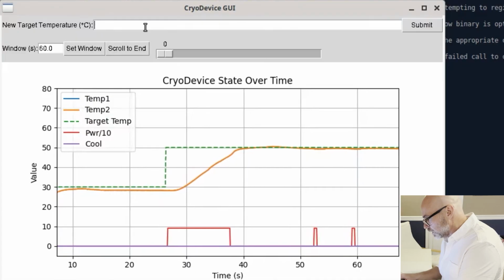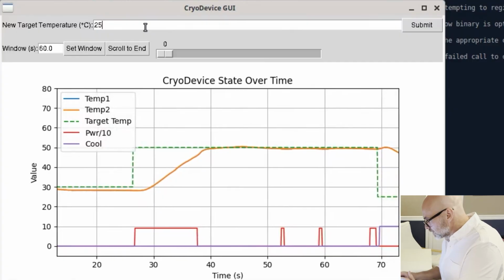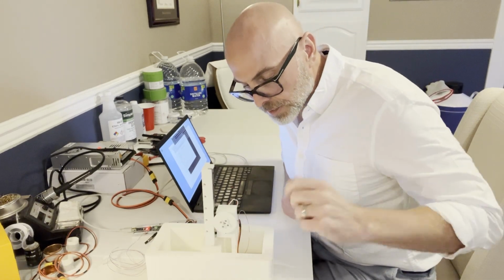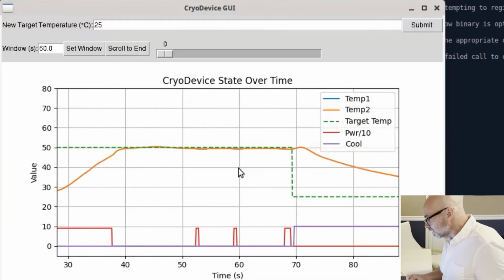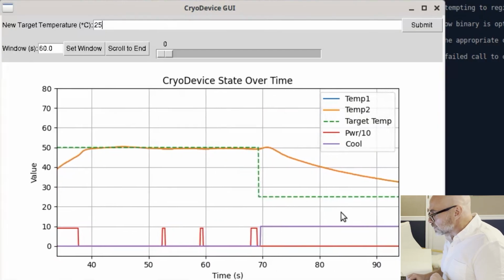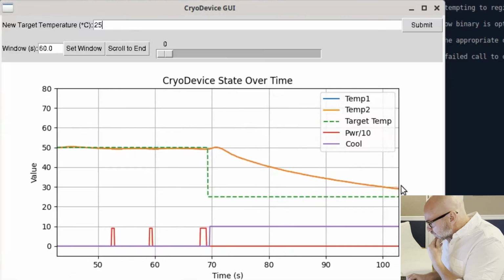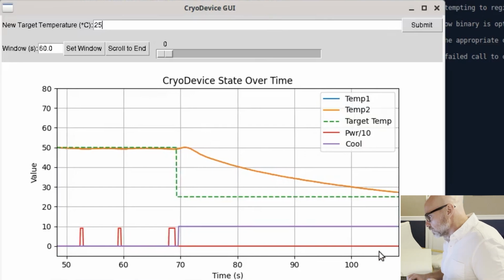And then if we go down to say 25 degrees, which I never commanded it intentionally below 30 degrees, but we'll see. So now it turns off the power, plunge. You heard it ring. So it moved down a little bit. That's because it's actually plunging that well down in the liquid. Yeah, and it's pretty cool. So it's plunged down in, and it's slowly getting there. Obviously, the temperature difference between the liquid and the commanded slows down the rate of change. That's Fourier's law of heat transfer. It depends on the difference between those two temperatures.